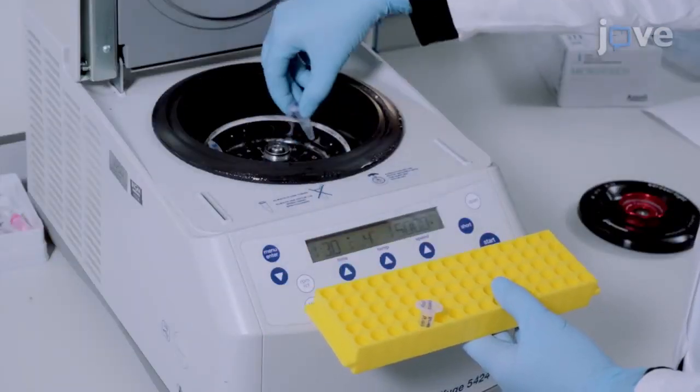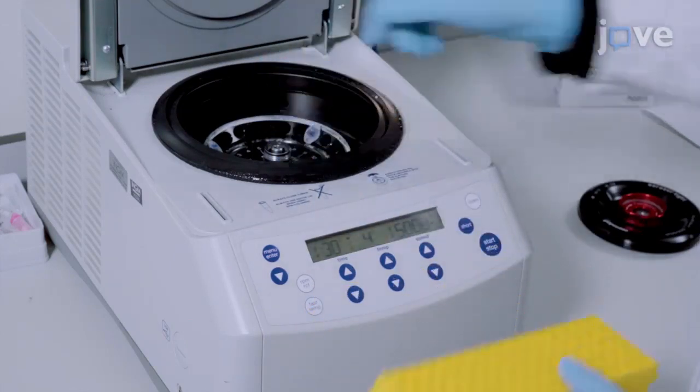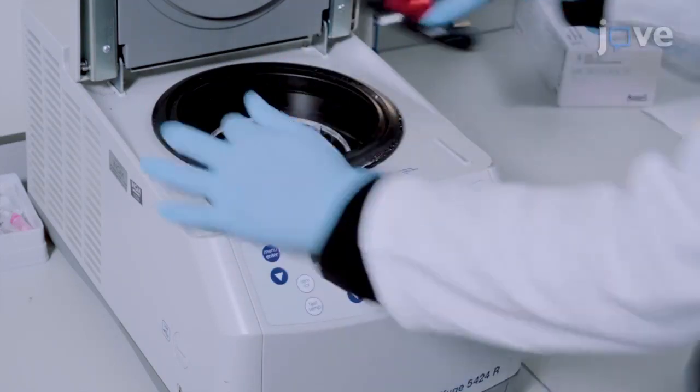At the end of the incubation, centrifuge the sample at maximum speed for 1 hour at 4 degrees Celsius.